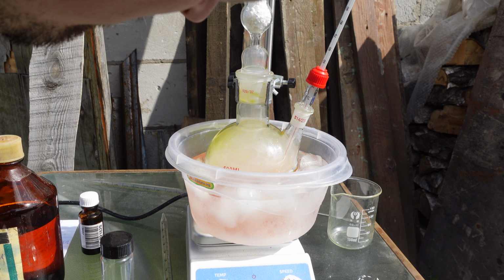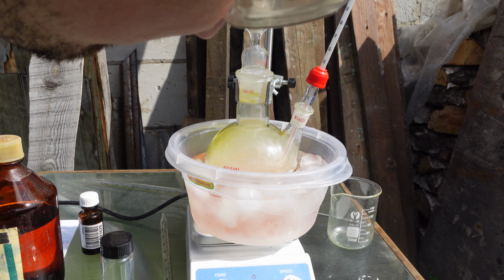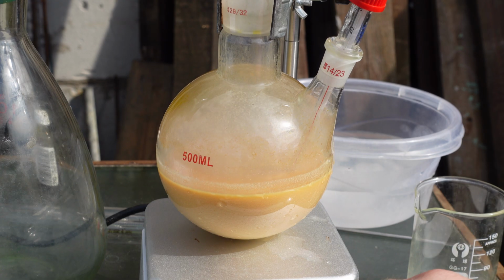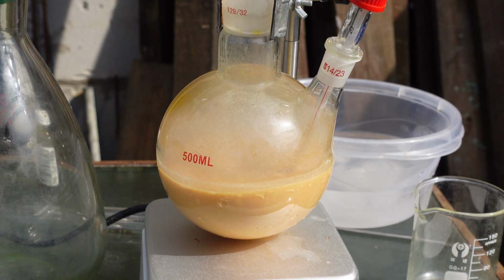So I added all the oxalyl chloride. Then I decided to compensate for the reduced yield by adding a 1.5-fold excess of triethylamine and oxalyl chloride. Generally, taking an excess of scarce oxalyl chloride isn't ideal, and next time I'll simply dry the reagents. You can do this with molecular sieves, for example.